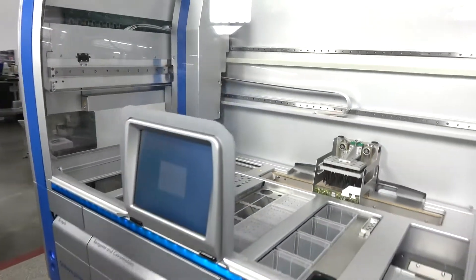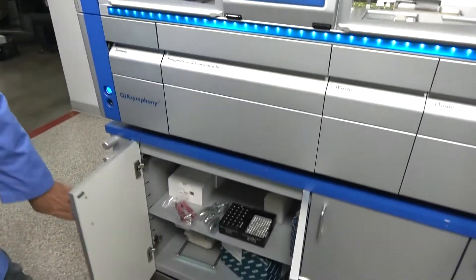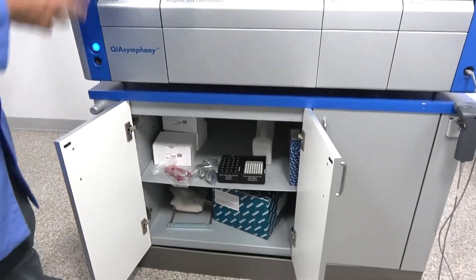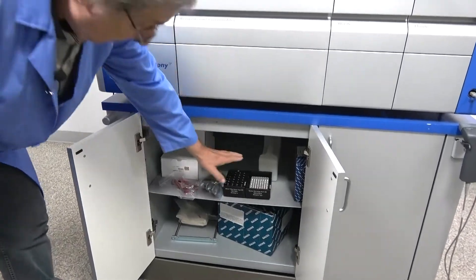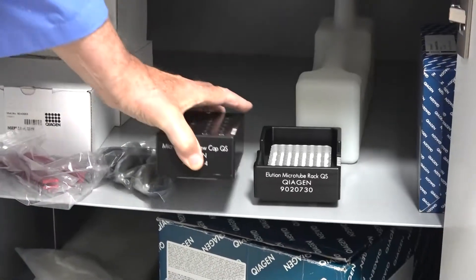Doors lock. Okay, it's actually done with its major portion. So we're going to return to some of the things that you want to know.